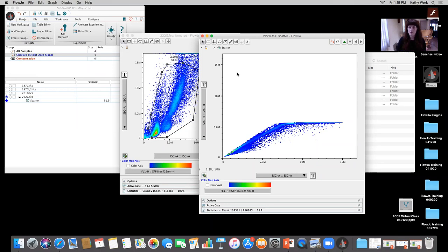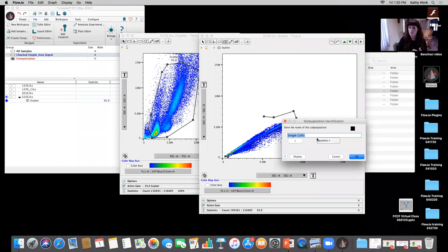Or you can mix up how you utilize it, as long as you're looking at the same detector, right? So you can look at side scatter height versus side scatter area. You can look at side scatter height versus side scatter width. Side scatter area versus side scatter width, right? There are all these different options that you can choose from, but what I'm seeing here immediately is that I can no longer use side scatter height versus area because I reached saturation on that side scatter height. And everything is plateauing at this point. And if I wanted to set up a gate like I typically would for singlets, how can I accurately determine where the singlets are once it's plateaued down here? So I'm not going to be able to do that, right? I'm going to cancel out this gate.